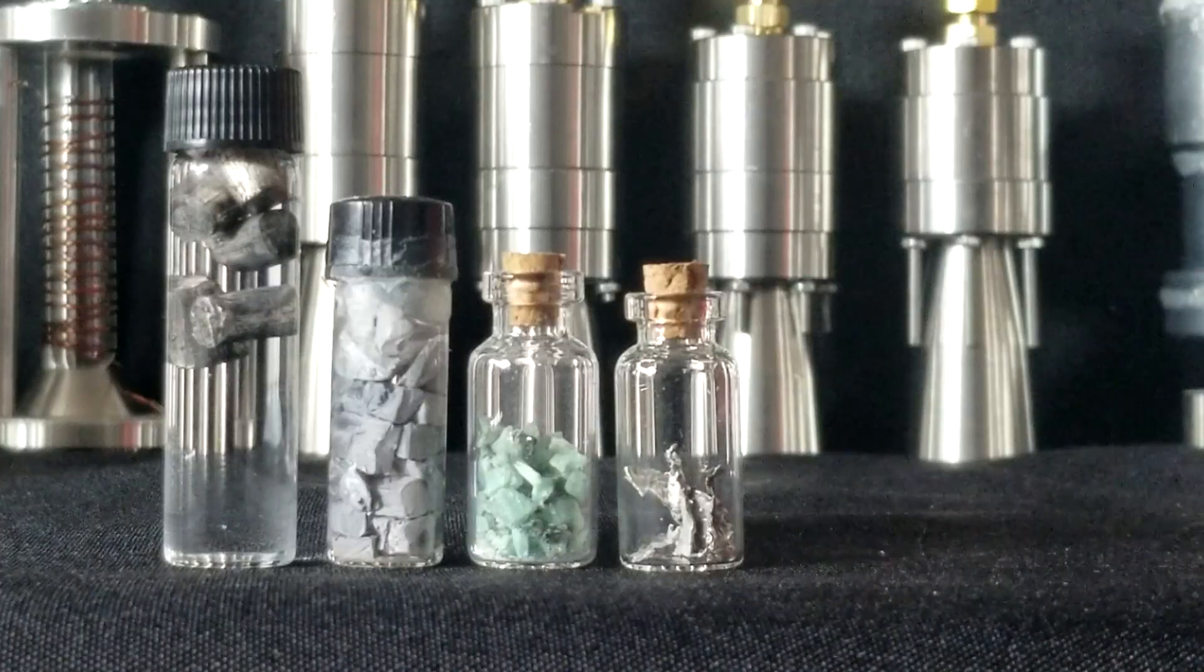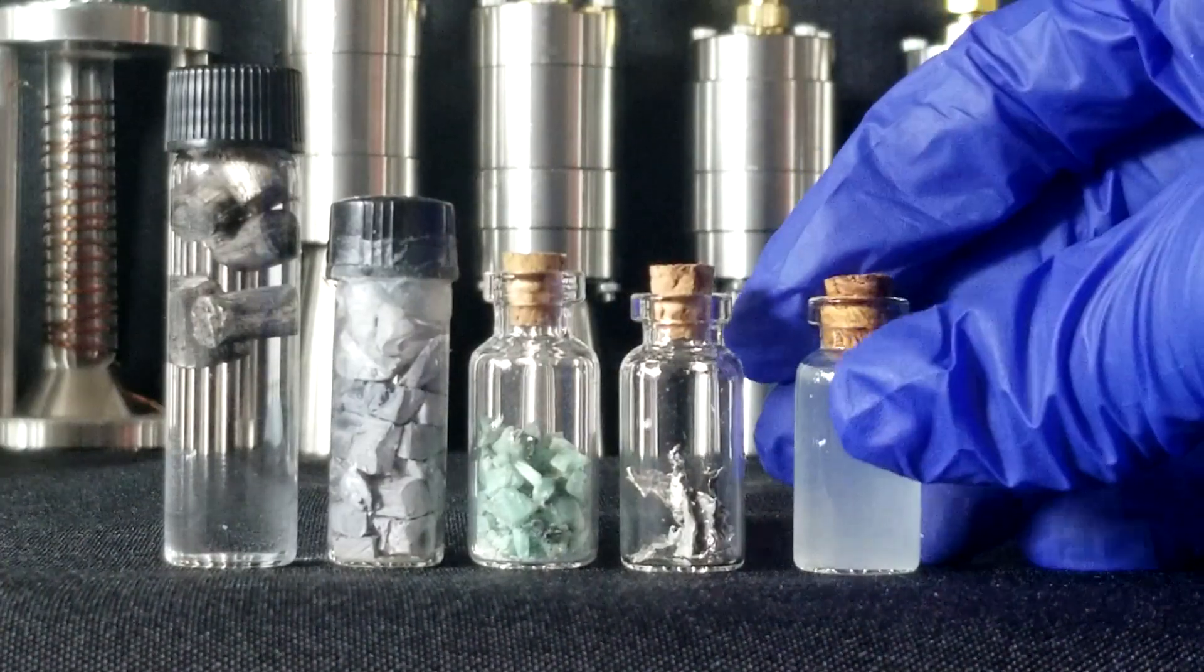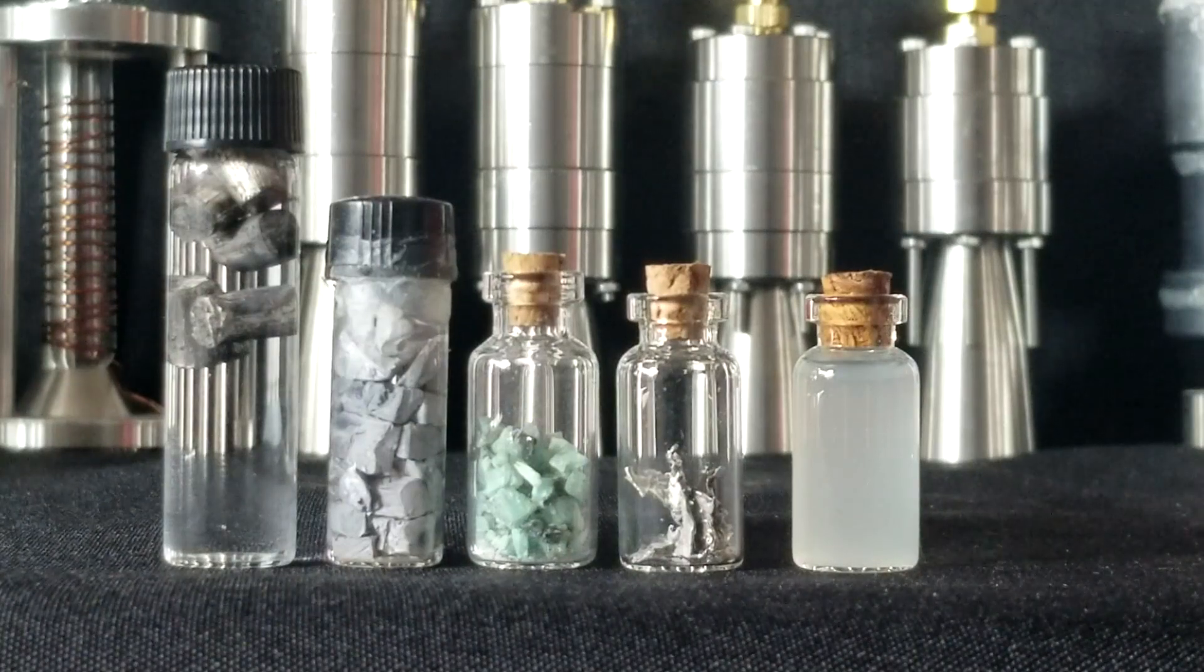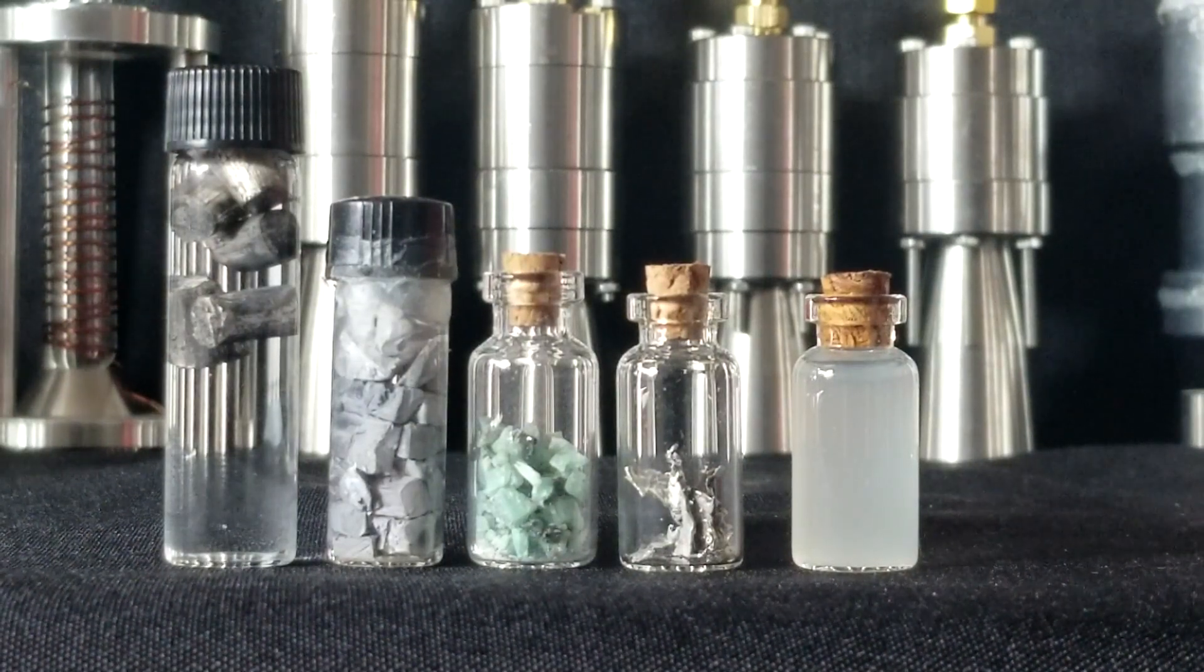For me, this is another curiosity for the chemistry collection for now, with lithium, sodium, emerald, and indium. In future videos, we will distill vanilla, rosemary, mint, and others.